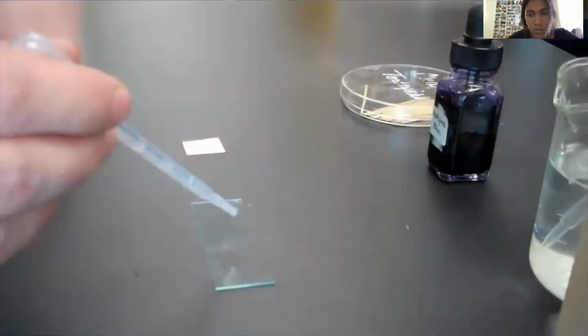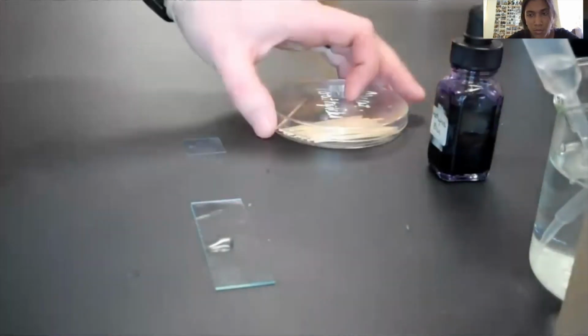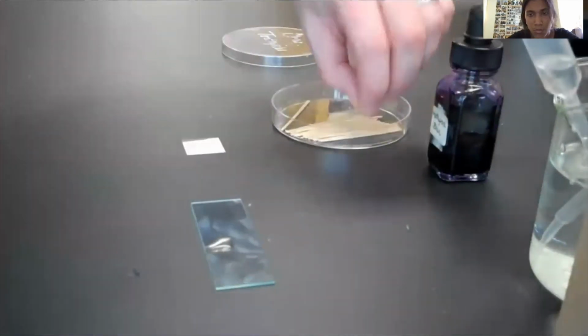In the second video, we learned how to make our own wet mount of cheek cells that we can scrape from the inside of our cheeks using a toothpick. The process was simple and consisted of the usage of just methylene blue, a slide with a cover slip, water, a toothpick, and a tissue paper.